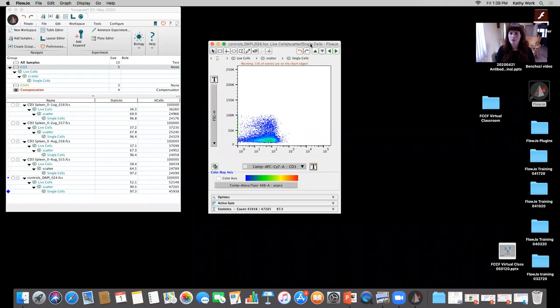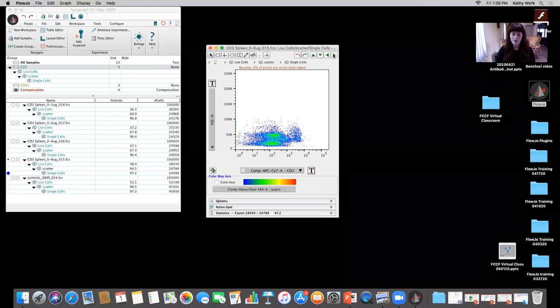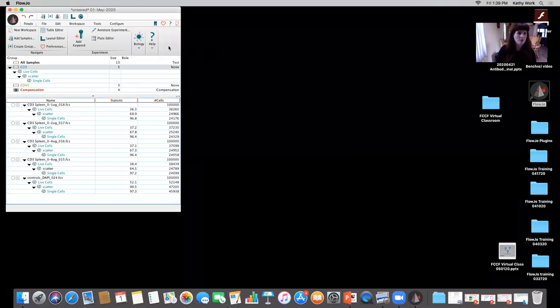Okay, so this example, if we're good to move forward, is CD3, right? If I scroll through, you can see that CD3 is shifting up. We went from 0.1, 0.2, 0.4, and 0.8 micrograms per mL. I've shown in previous sessions, the first session actually, in our introductory section, how to do manual gating and how to manually do statistics. I'm going to show you a plugin that you can get on the FlowJo Exchange today. I'm not going to go into details on how to download the plugins and put them in the software. Please reference the last session recording for that, or if anyone has a question, I can show you very briefly towards the end.